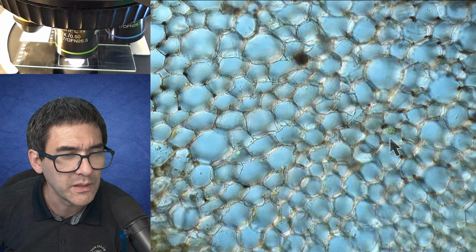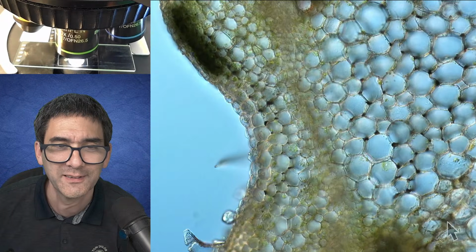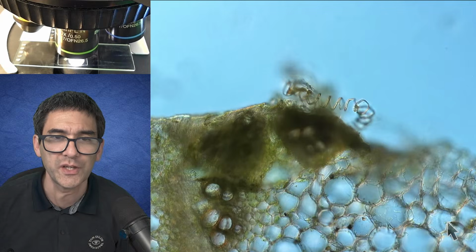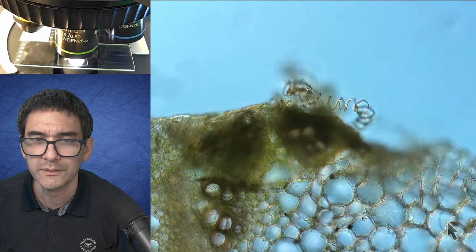Let's move the arrow away here again a little bit so that it doesn't disturb too much. Bubble wrap, yes. Again, look here. The xylem kind of shows how much stronger it is, because it's almost like a wire, right?